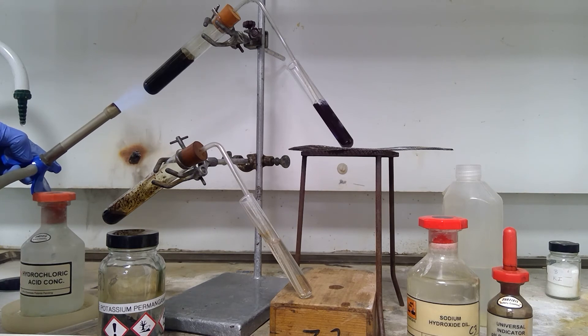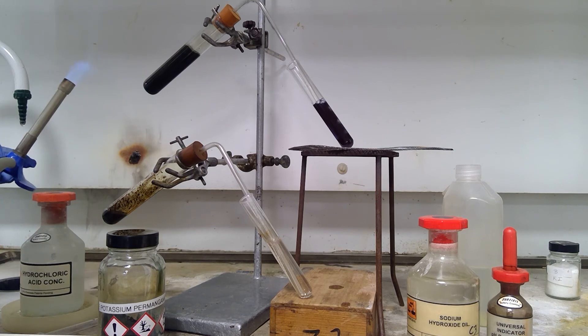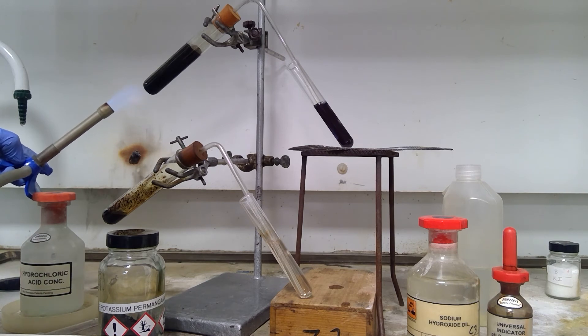The production of chlorine even on heating seems to be perhaps slower than when we had it with the manganate 7. So it's taking a lot longer for the blue color to change and for the sodium hydroxide to be neutralized.